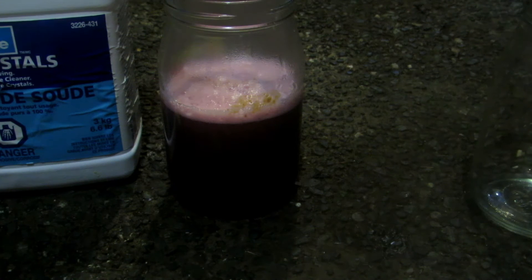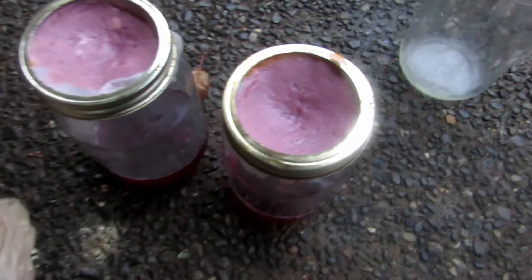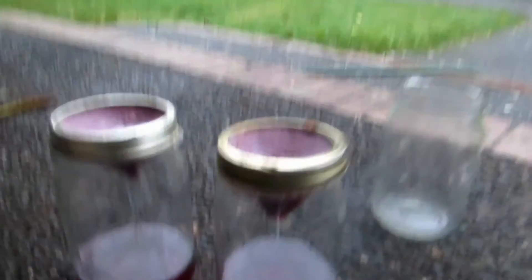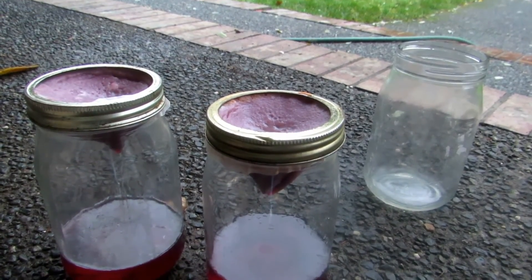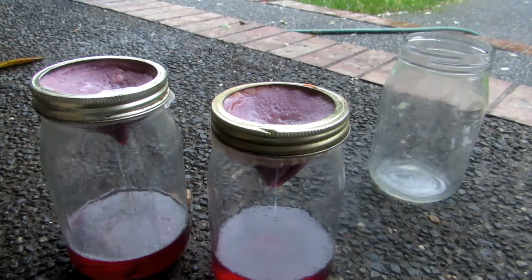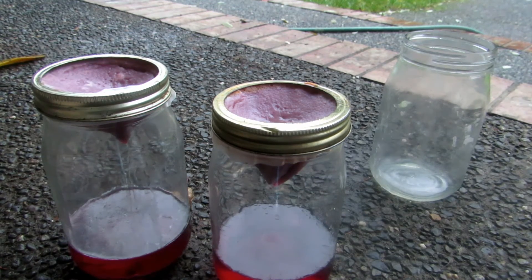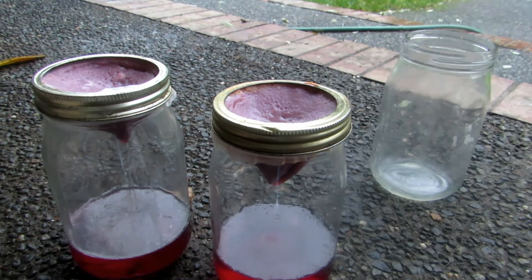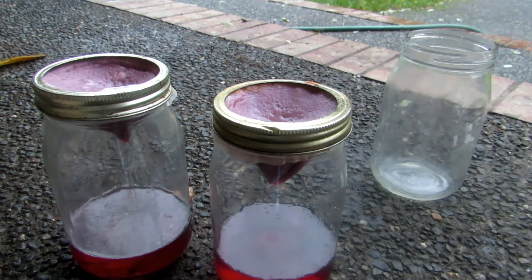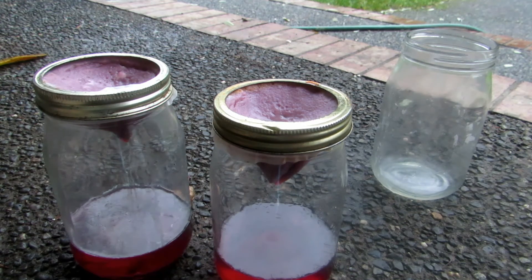I may add more sodium hydroxide solution to make sure everything has precipitated, then filter it off. After filtration, there's a very beautiful pink layer on top. I looked it up in the Merck Index — this is the color of cobalt hydroxide, so we clearly have cobalt hydroxide. Now all we need to do is re-react it with hydrochloric acid to form pure cobalt chloride, free of lithium since all the lithium remains in the solution below.